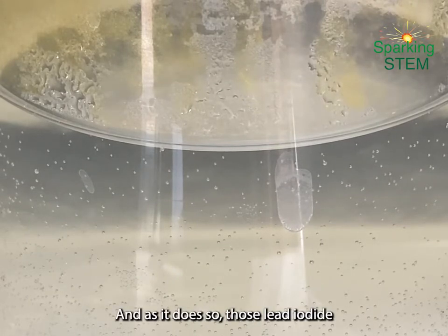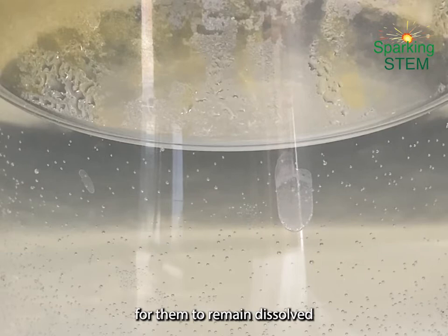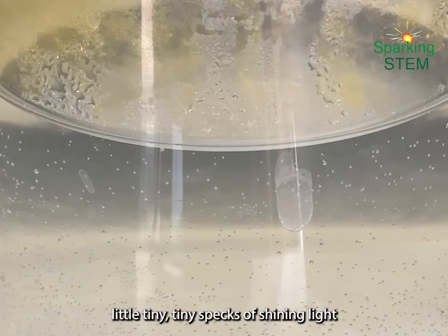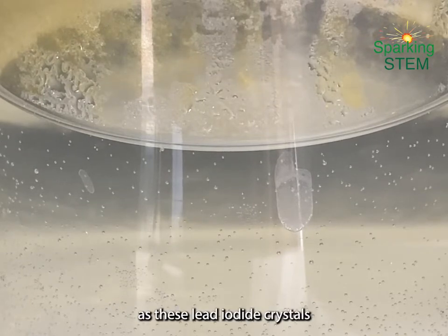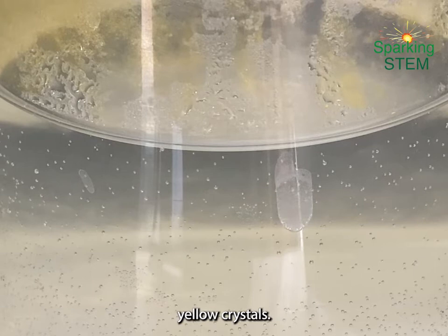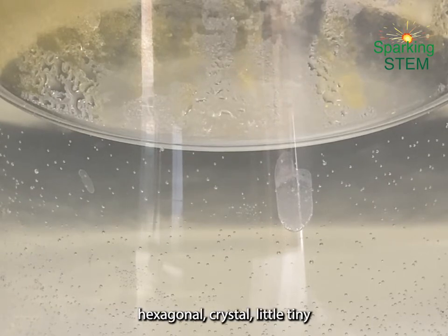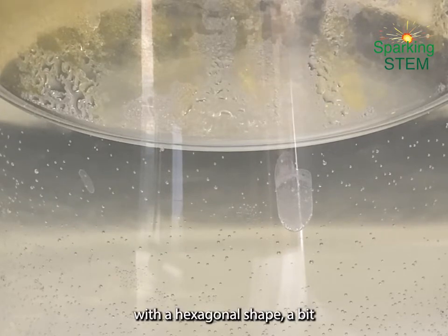And as it does so, those lead iodide crystals lose their solubility as well. It's harder for them to remain dissolved into the solution. Now you might just be able to start seeing here what looks like little tiny specks of shining light flickering around as these lead iodide crystals recrystallize, turn back into crystals, these golden yellow crystals, but this time because it's recrystallizing, they come back as a bigger hexagonal crystal, little tiny thin plates of lead iodide with a hexagonal shape, a bit like snowflakes if you like.